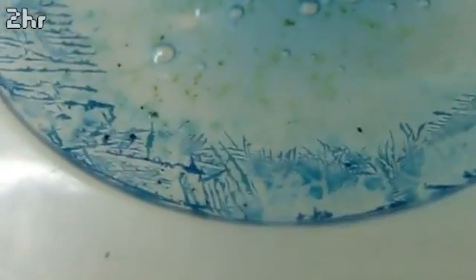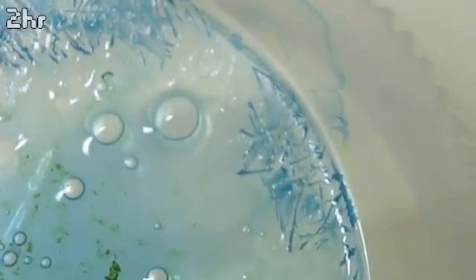There's a closer shot. You can see the pattern that they evaporated in, pretty cool. Another interesting tidbit is these bubbles.